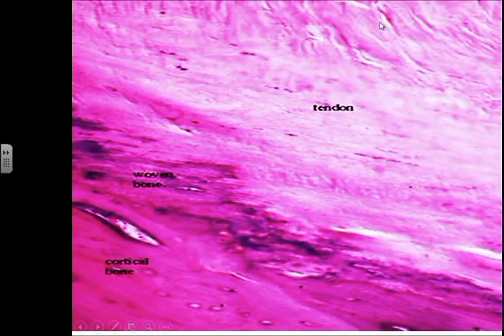This image shows the junction between the tendon and the bone — at the cortex of the bone where the muscle ends, a tendon attaches. This site represents one of the weakest portions of the tendon, and because it's weak, it's liable to injury. We can see that the collagen fibers in the tendon change to become first woven bone and then cortical bone.